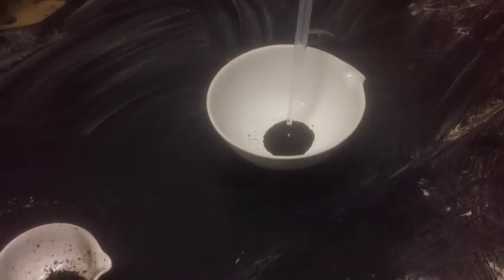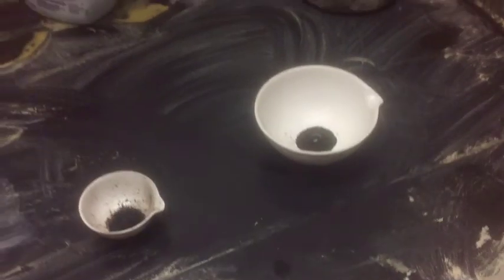Let's observe the reaction again. This time, we'll use a mortar and pestle to break up the KMnO4 crystals into smaller crystals, increasing its surface area. Again, we add 1 milliliter of glycerin to 5 grams of crushed KMnO4. The vapor and flame appear much sooner.